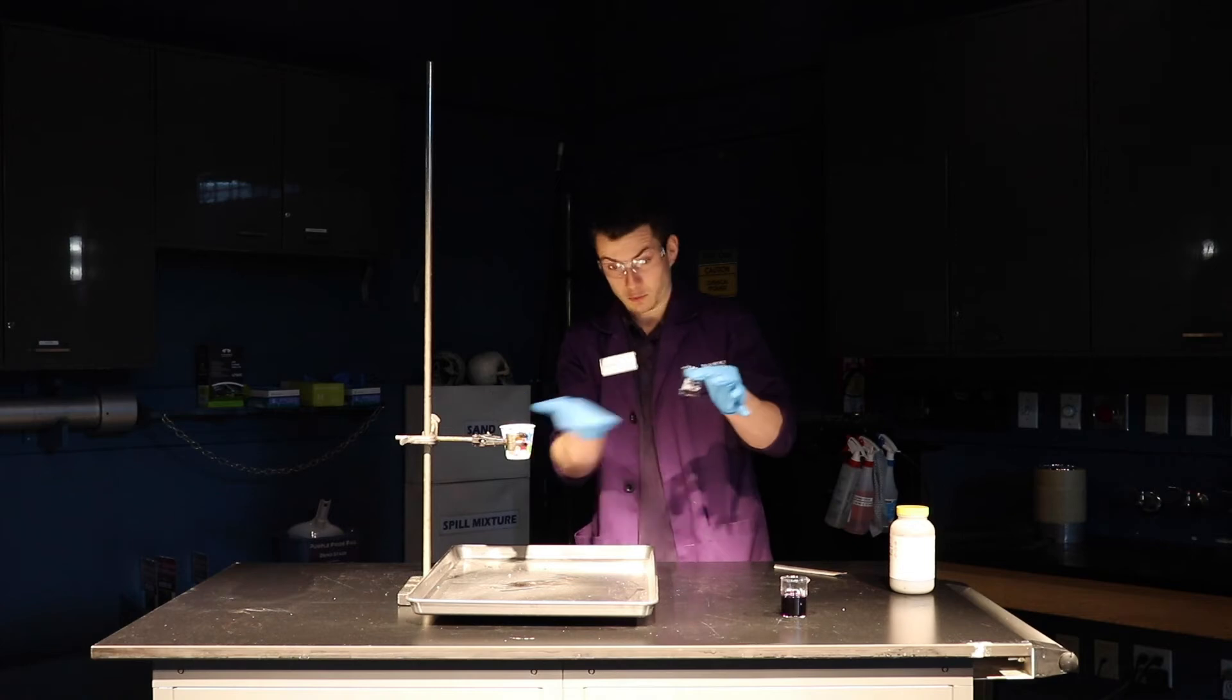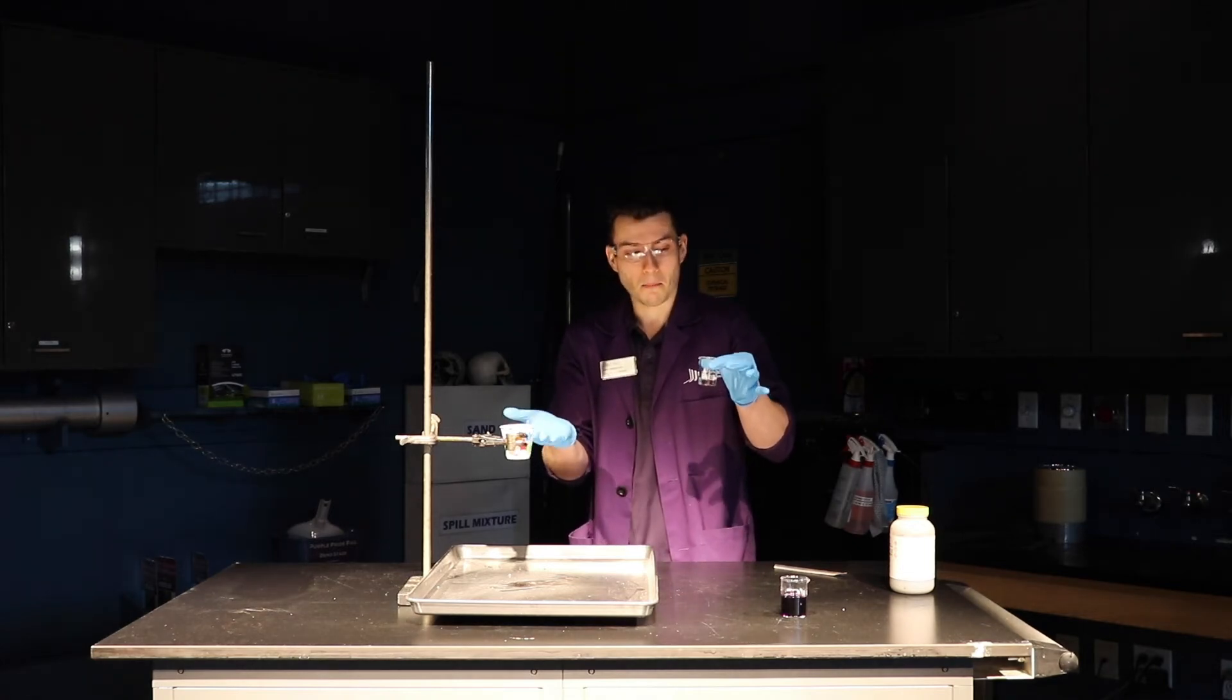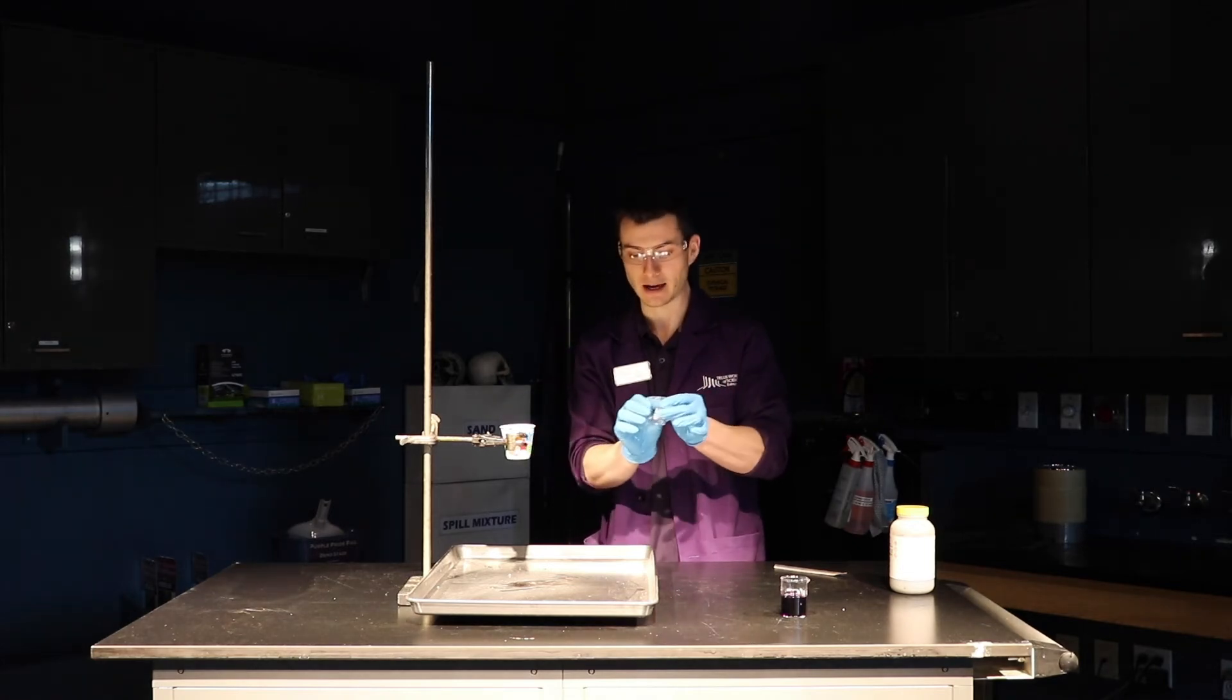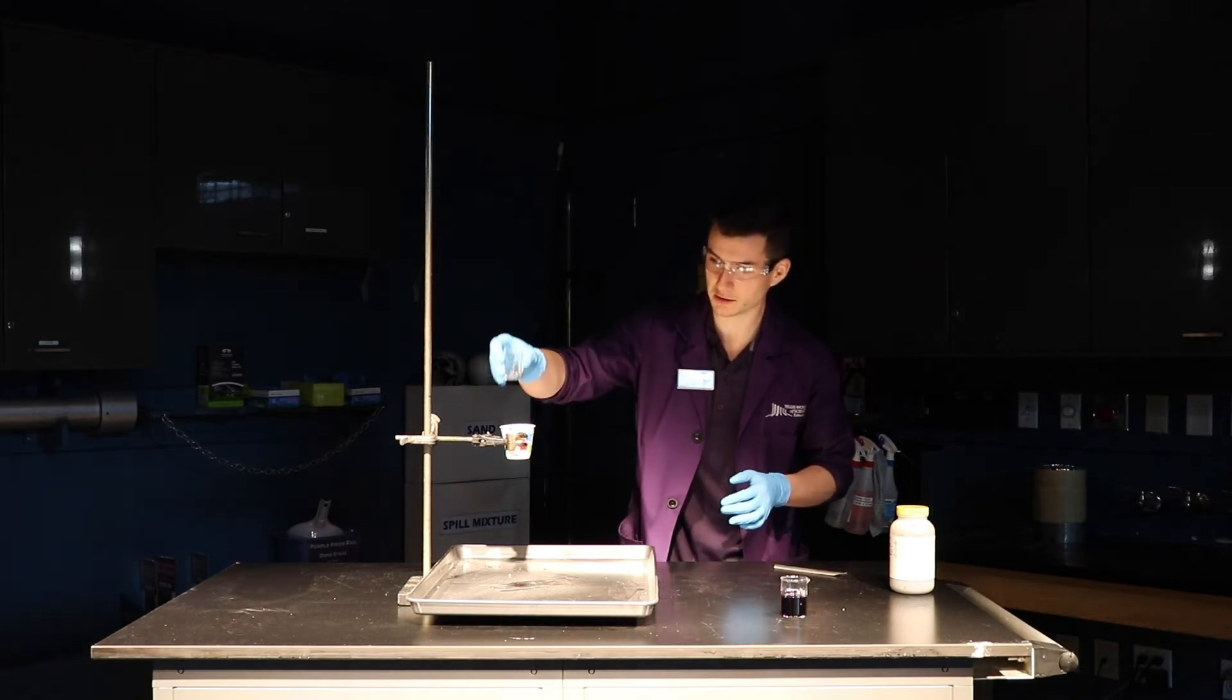And what we're going to see here is something called a spontaneous combustion. That's our experiment today, a spontaneous combustion. So I'm going to pour in the glycerin.